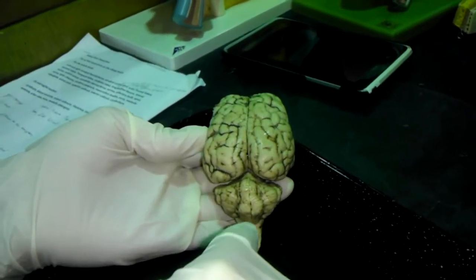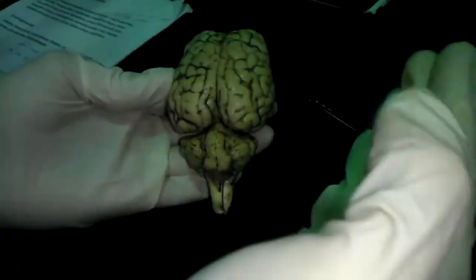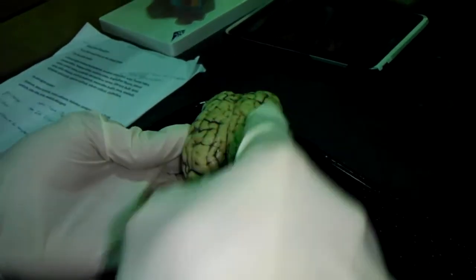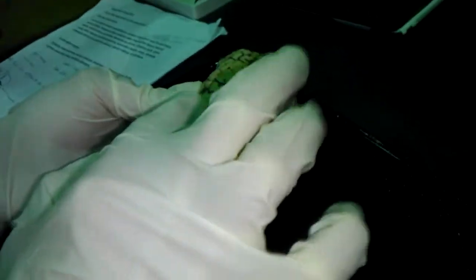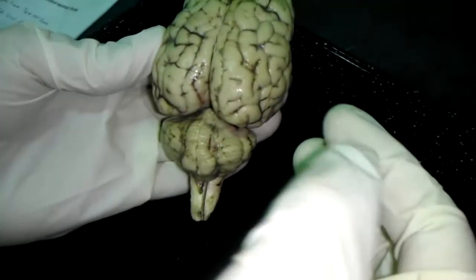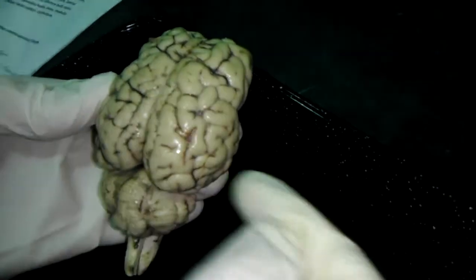Okay, so the brainstem's here pointing backwards, so this would be the left side and this would be the right side. So left cerebral hemisphere, right cerebral hemisphere. The cerebral cortex is the gray matter on the outside, so it's like this whole brain area. Gyri are folds, so all these little tracks that you can kind of trace your finger around, and all the gaps in between them are all sulci.